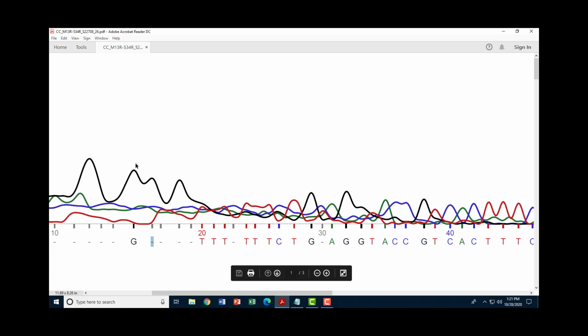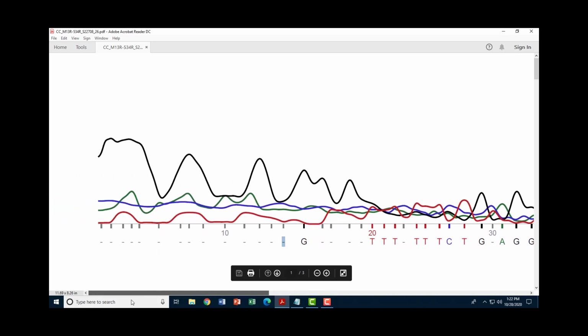Same for that one, clearly identified based on its criteria, but then we get to this position right here. We have thymine on the downslope, a flat adenine, a little bit of a bump for cytosine, and clearly a dip, a reduction of signal coming down for guanine. So this one, I might plug in cytosine in that spot, the C. So as you get closer and closer to the front of the trace, it becomes harder and harder to tell these things apart. But you can look at these and try to use a little bit of deductive reasoning.